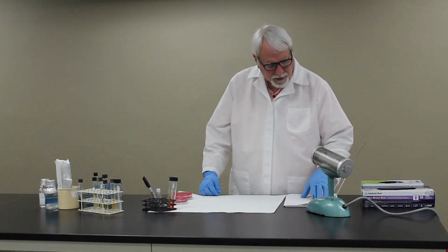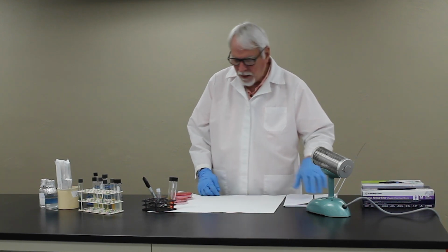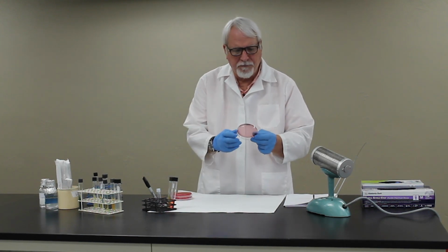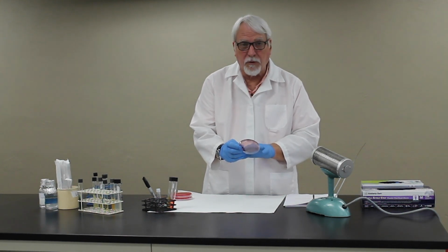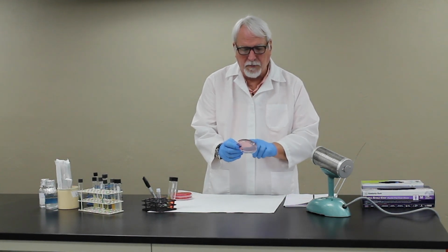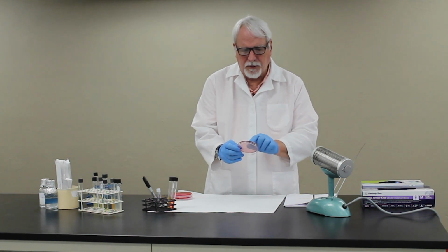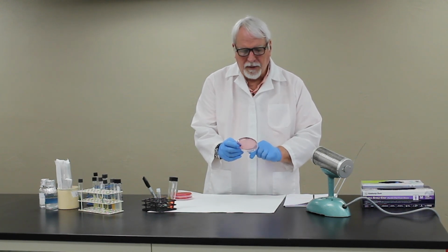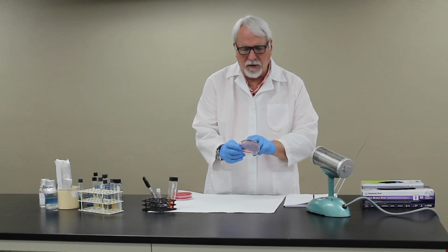So you've already had your exercise on streaking blood agar. The thing we'll introduce you to this time, which is a little different, is mannitol salt agar. This is a selective and differential media that's useful with the gram-positives. We'll streak it just like you streak the blood plate in 4 quadrants. And what we're going to be looking for is the production of a yellow colony on this particular agar. That will indicate mannitol fermentation or acid production from mannitol.